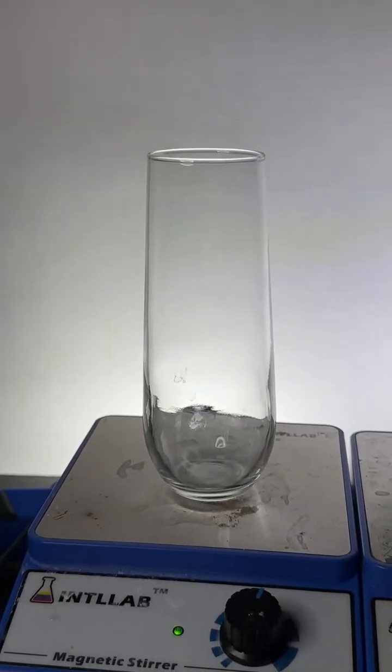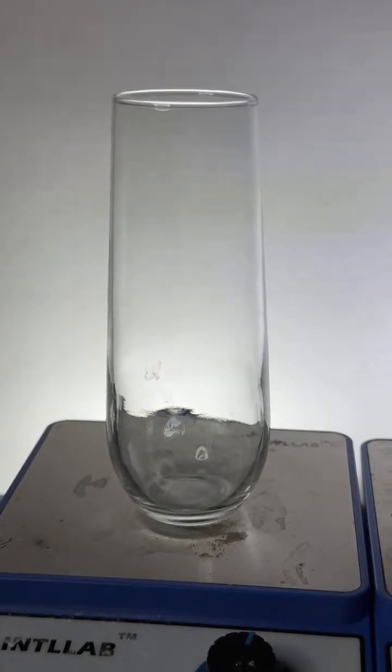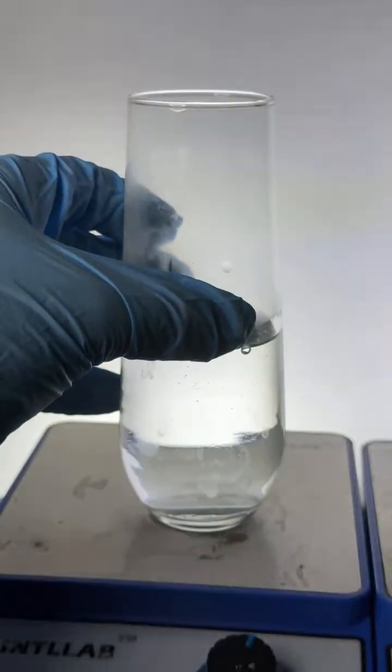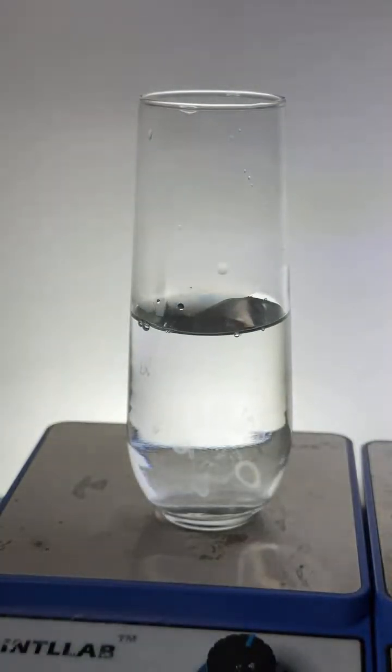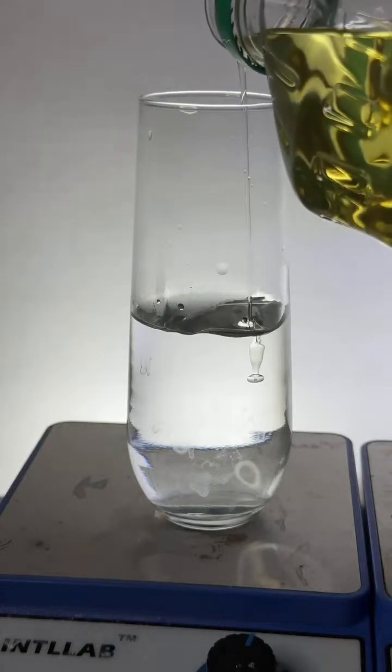Yes, it would work with ethanol. Ethanol will work. The salt that I find works best in this experiment is going to be potassium carbonate. I just used sodium carbonate in this experiment, but potassium carbonate is going to work fine. Okay, so there is a little bit of water. Let's add some oil. No, because the blue dye was just blue food dye.